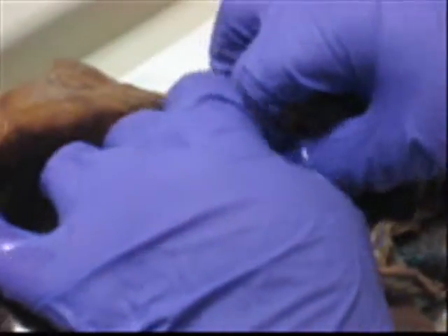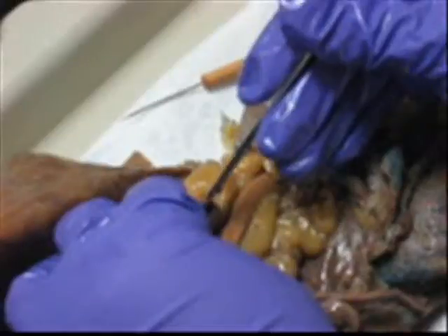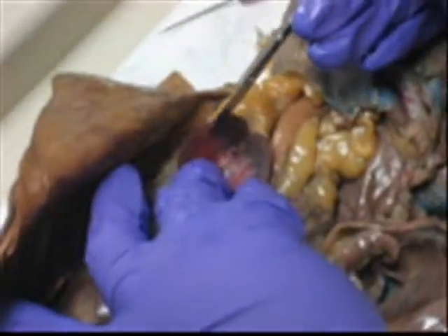It's really big. And then I need a scalpel. Tuning into random conversation. Yeah, I know. Me too. I heard it too.